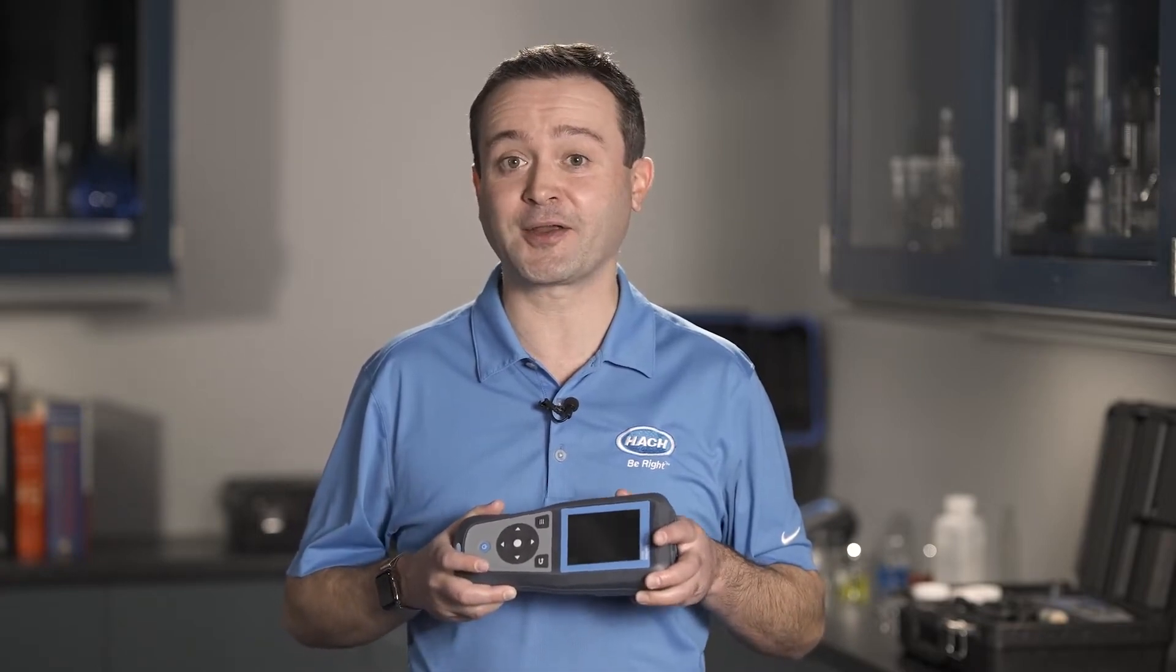An accurate measurement is only possible with a successful calibration. In this video, I'll be walking you through how to calibrate on the new HQ Series portable meter with on-screen, step-by-step instructions.